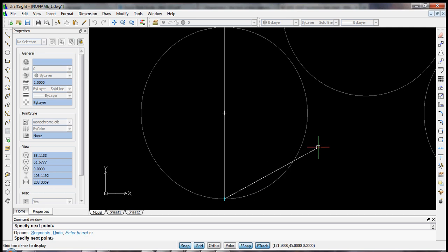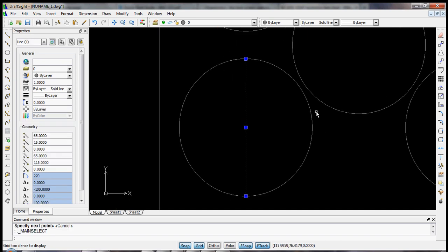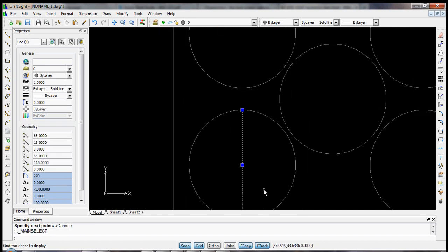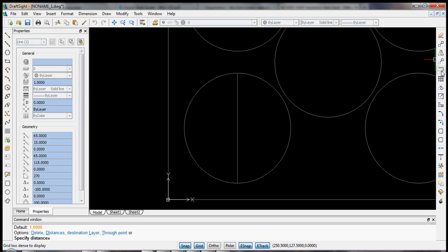and you can see you can keep clicking lines, they'll all be linked together. If you hit escape, then you will just be left with the line that you've clicked. Okay, now let's learn about a command called offset. What offset does is it will take any element and it will make another element that is offset in one direction or another from the line by a fixed value. And that is this element up here, this icon, or you can type offset.